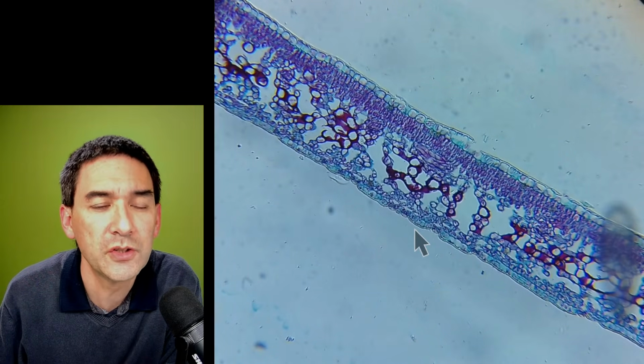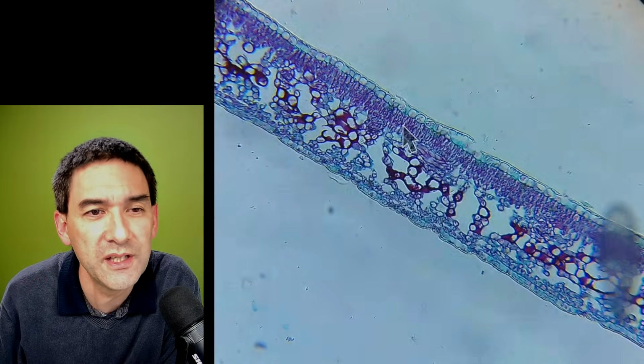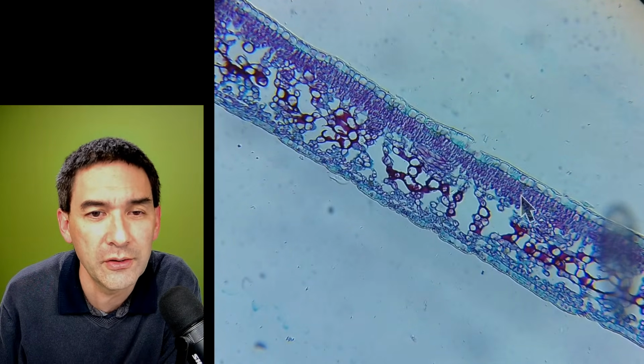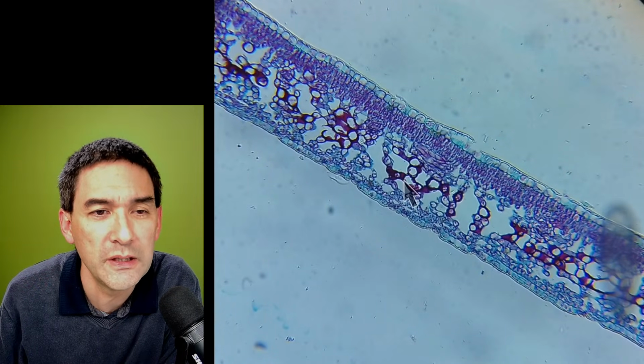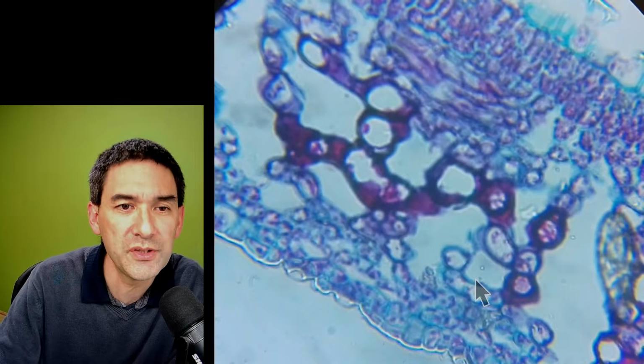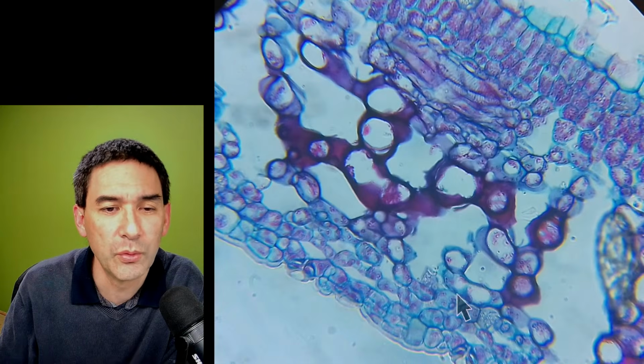Looking at this, of course, as a biology teacher: this is the top side of the leaf. You see that the cells here are arranged very regularly, called the palisade layer. Down here you've got the air spaces, that's the spongy layer. So that's the top side of the leaf, and that's the bottom side. I'm quite happy with this; the image quality with this mobile phone is quite okay. It's focusing again.